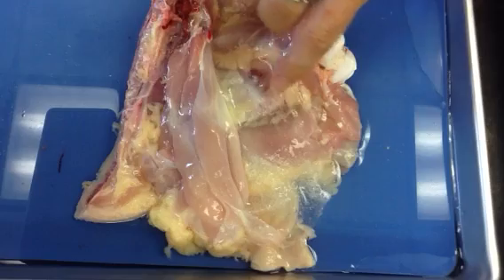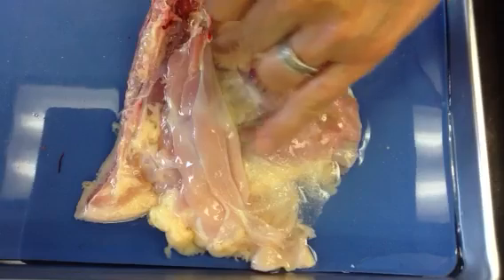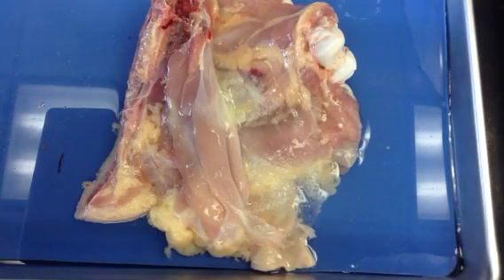This collagen protein will lose its integrity and begin to turn white, and then it'll show up really well. When you run hot water on it continuously — which we're having difficulty doing right here since we're not at the sink — you'll actually see fibers kind of pop out in various directions running throughout there. It's a fun thing to do under the faucet if you have nice hot tap water. It's an interesting experiment to do.